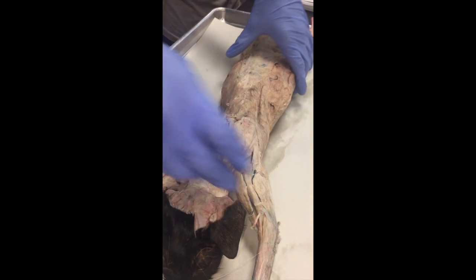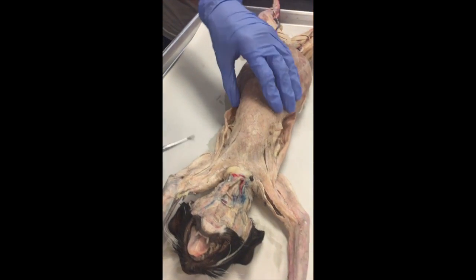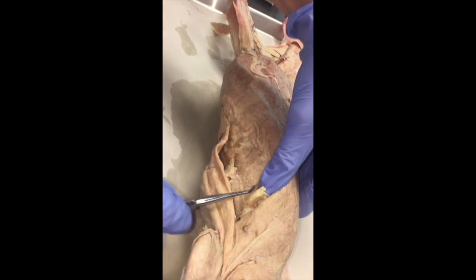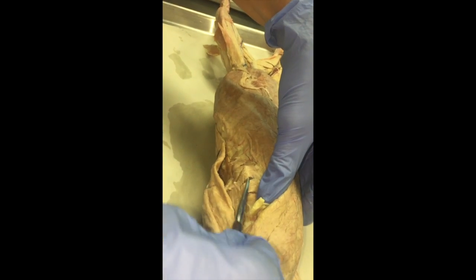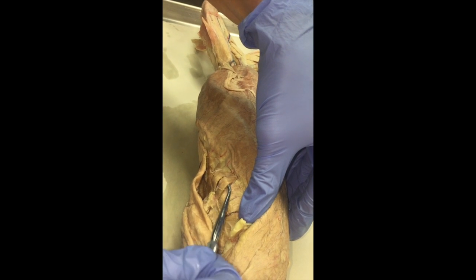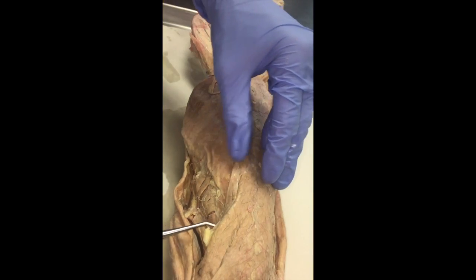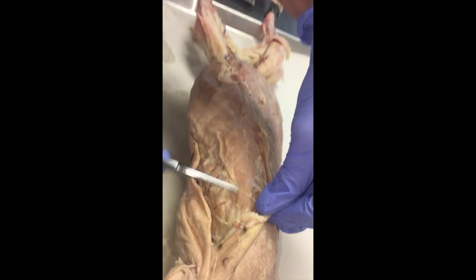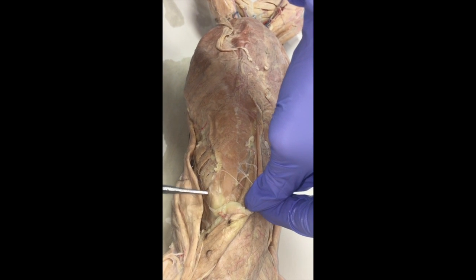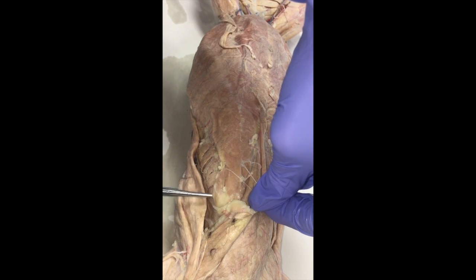Going into the thoracic muscles — we'll come back to the back muscles in just a bit. The thoracic muscles include the serratus ventralis, that's our fan blade here. We can pick them up and look at them individually. Then if we go anterior to that, we can see the scalenes, which are the ones that run longitudinally with the body axis. You don't need to differentiate which scalene is which, just that these are scalenes.